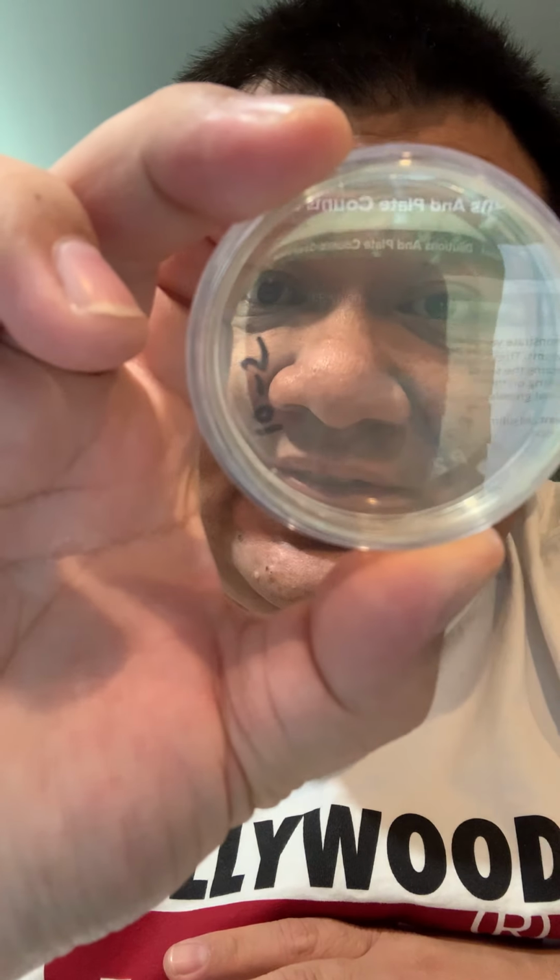10-5 is the same, and 10-6 is also the same. That's between 4, 5, and 6. I'm not sure if there's any growth. I actually let it sit for another 24 hours, hoping that the petri dishes 10-4, 10-5, and 10-6 would grow overnight and see if there were any new outcomes. But this is the 3-day mark, and there was no progress.